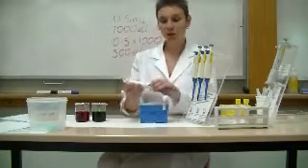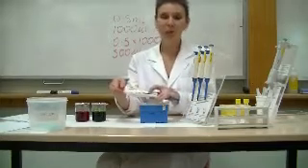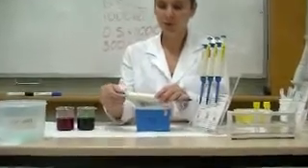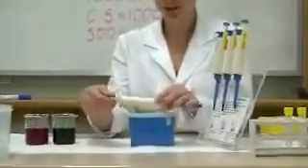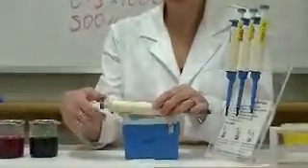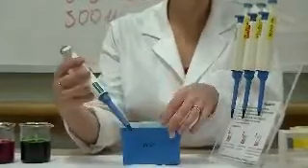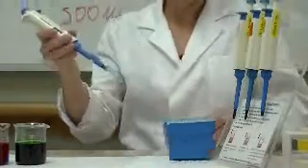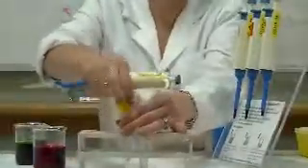and then I need to use the dial to dial up the correct volume. So I need to wind that until I see 500 in the window, being careful not to go above or below the range. Then I need to firmly attach a tip and get my vessel, which I'm going to place my solution in, ready.